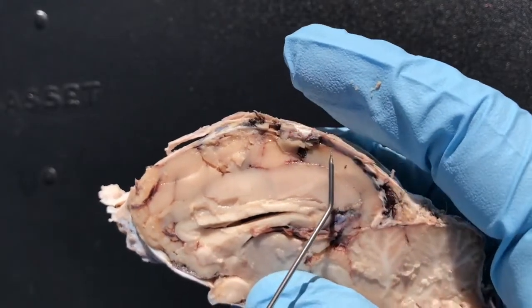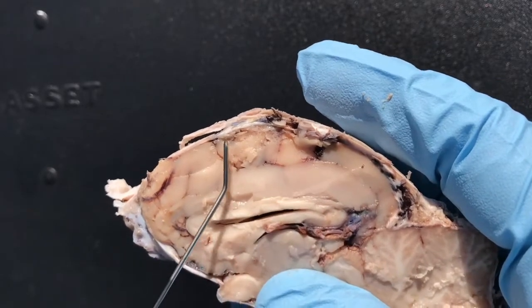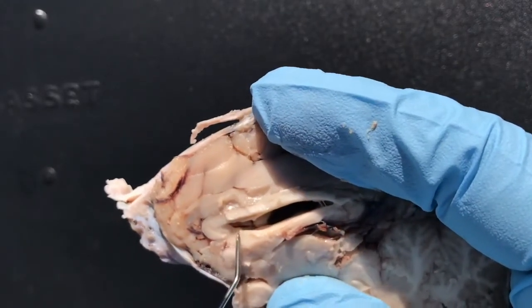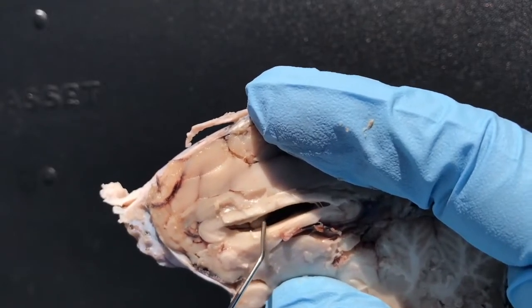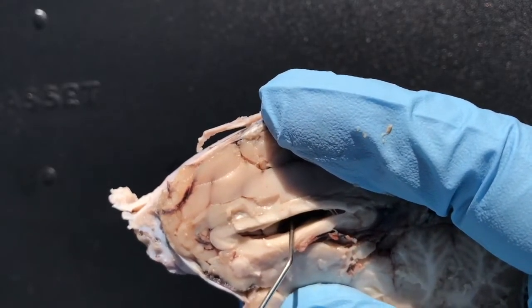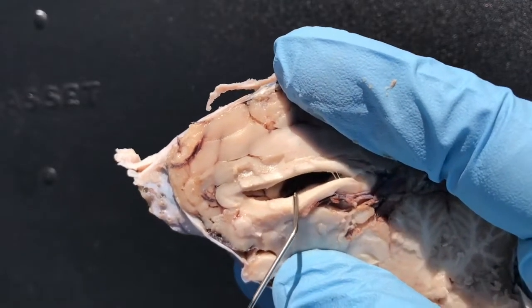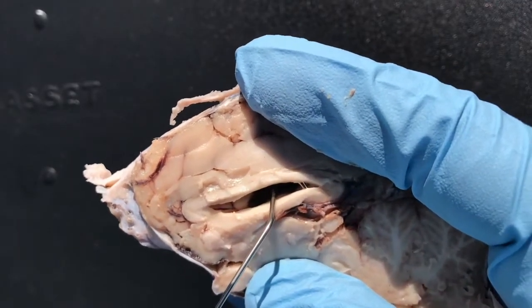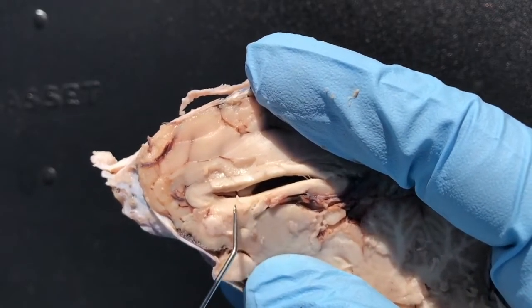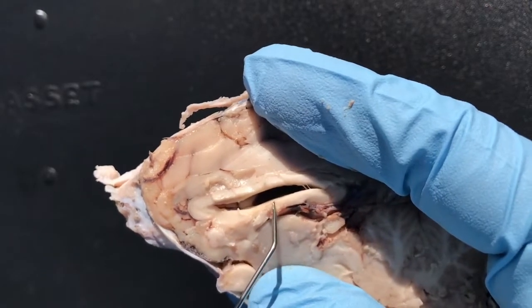So again, you have your right cerebral hemisphere — this is the cerebrum — and you have your corpus callosum. And that membrane that I tore, that was holding in the cerebrospinal fluid, that was the septum pellucidum. And now we're looking into the lateral ventricle, and the bottom border is the fornix.